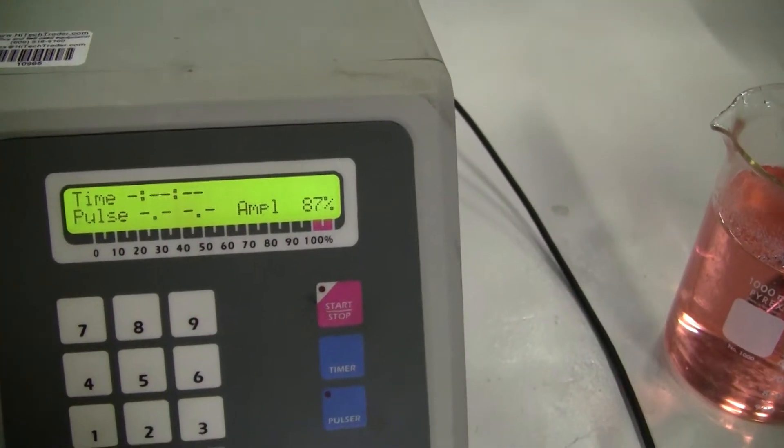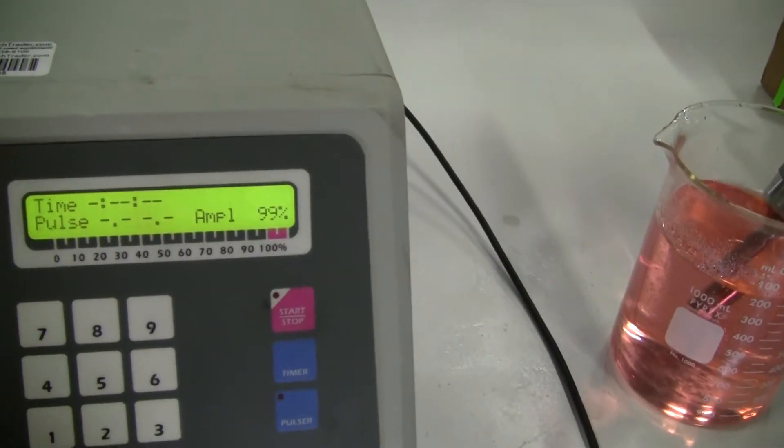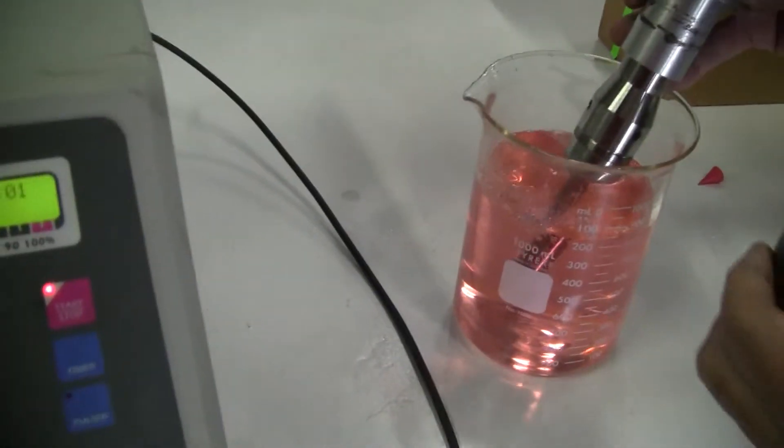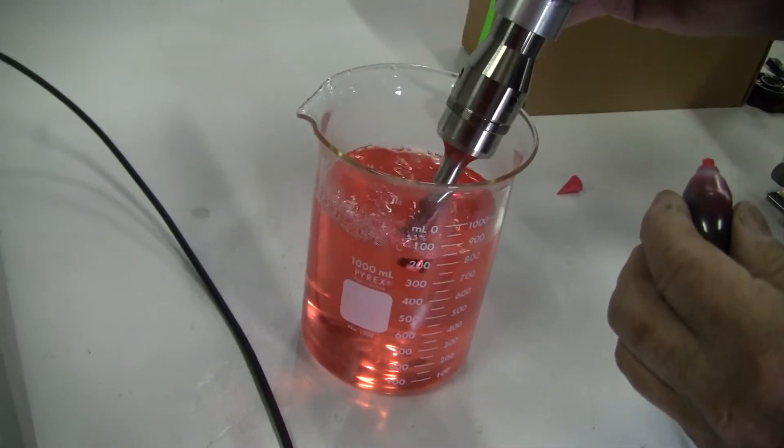Going up to 86 now. 88%. Move it to 100. That's 100%.